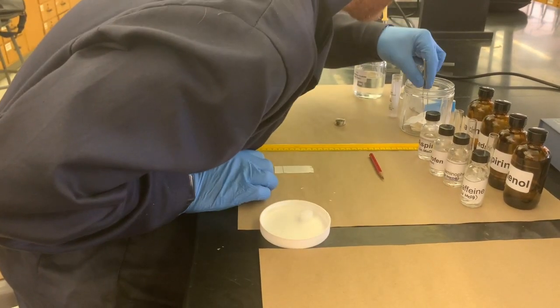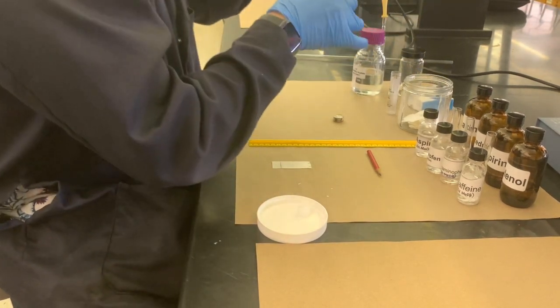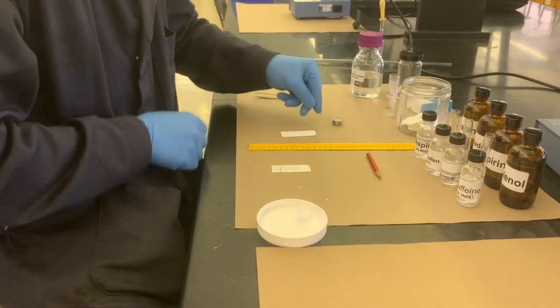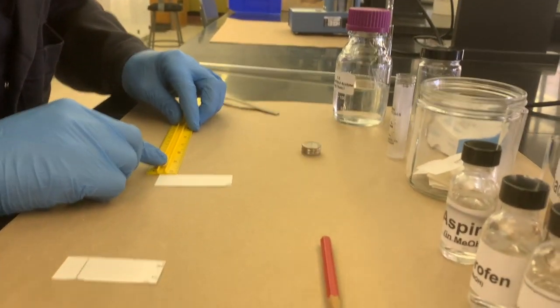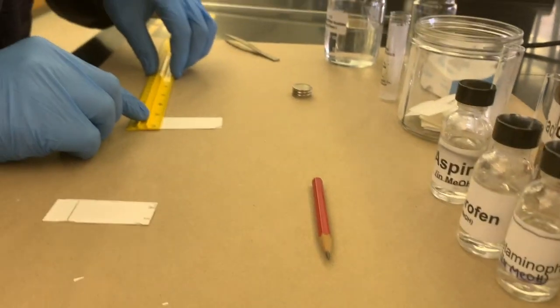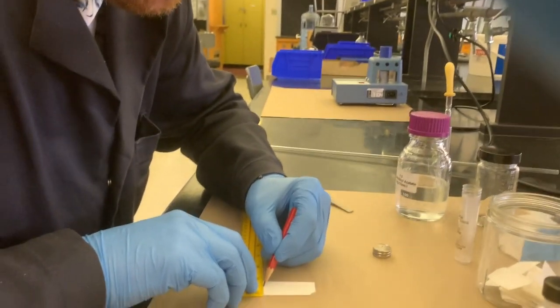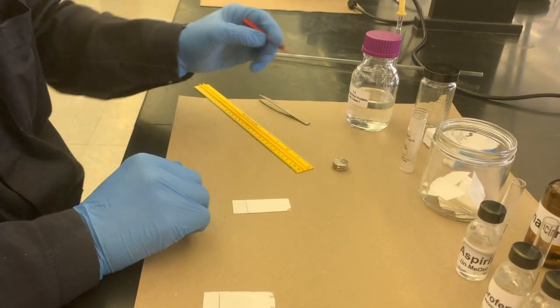Try to pick one out that has a more even coat on the bottom. I'm gonna be very gentle and not break any of the silica. And gonna draw those lines again. So you want to move about, let's say, 1.5 centimeters, similar starting point. And you will draw your line right here. Doesn't need to be too thick, just needs to be able to be seen so you can do consistent work.